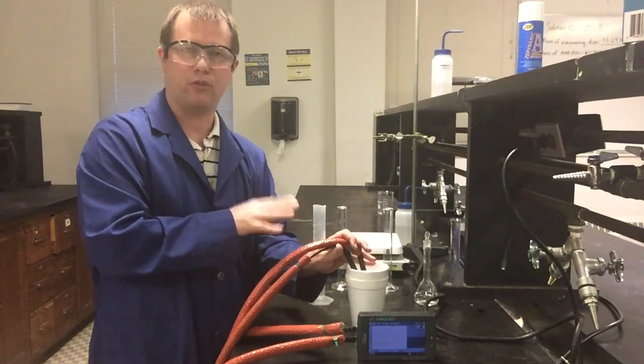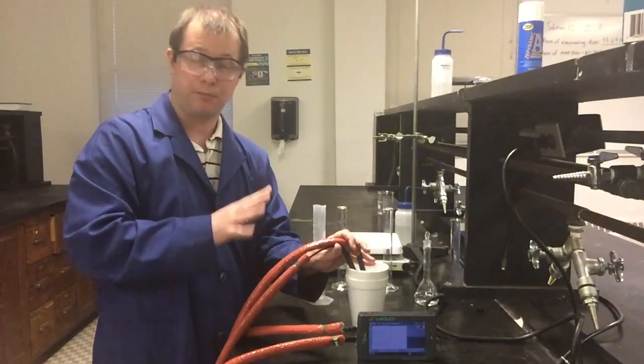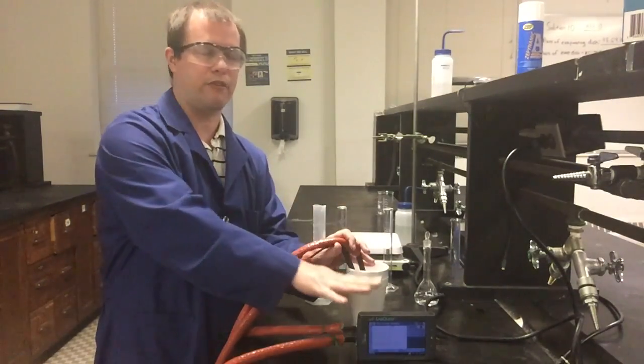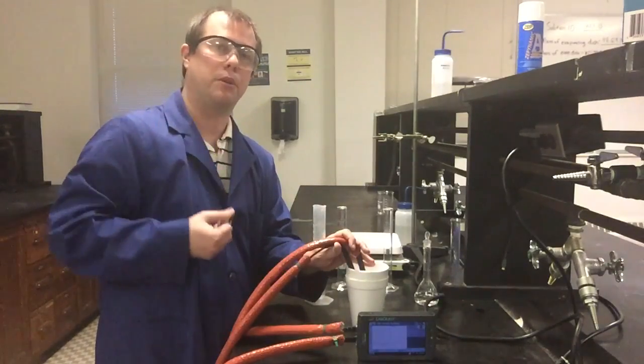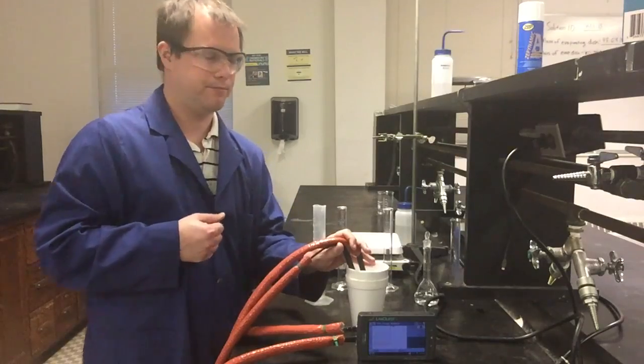But now what I'm going to do is basically monitor this temperature for the rest of the 5-minute time interval now that we've mixed. And then I'm going to do this experiment one more time for a second trial so that I have full data. I'll show you a picture of this when it's done, and then I'll talk a little bit about the Excel spreadsheet that we'll see with all the data in it as we finish as well.